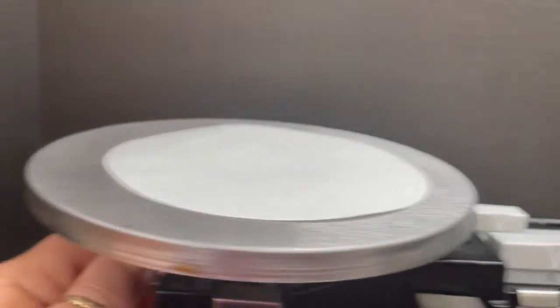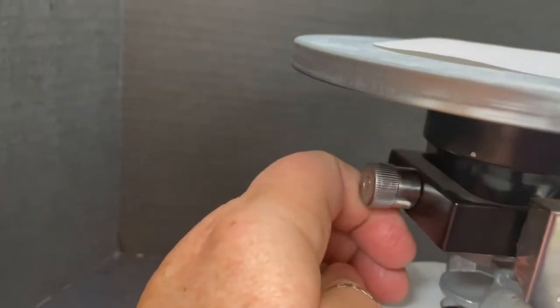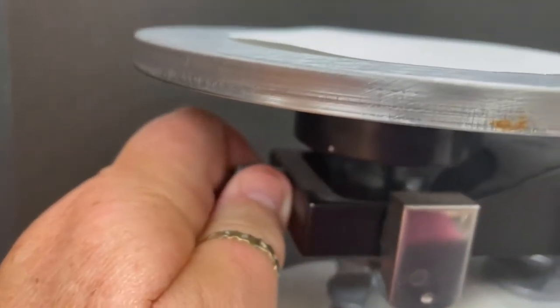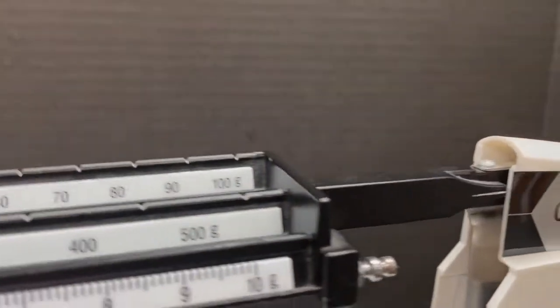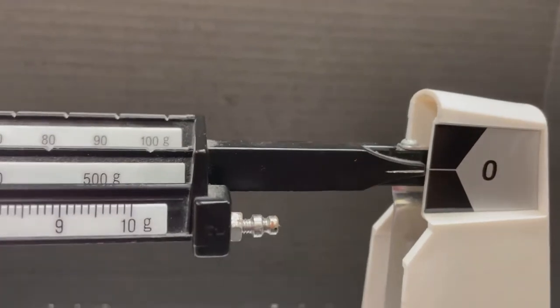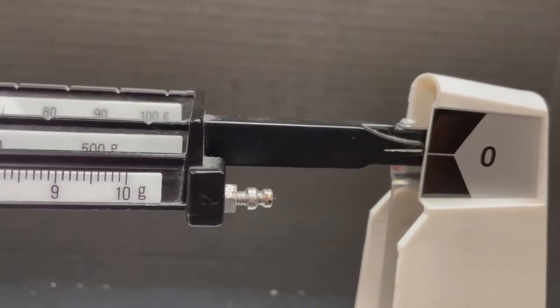It looks like it's a little bit off, so you use the adjustment knob located under the pan. Let's see if I can get it to change a little bit. This one's giving me a little bit of trouble. Okay, that looks pretty good. It's at zero.